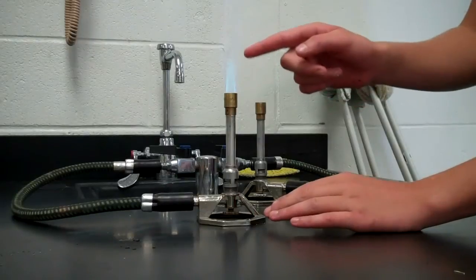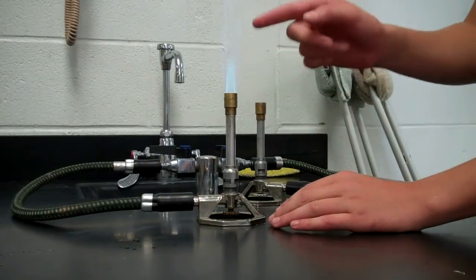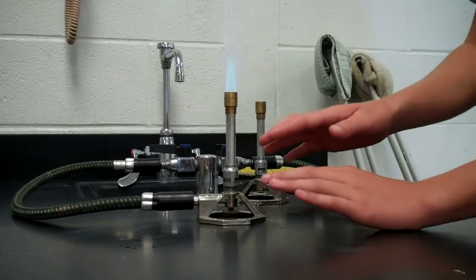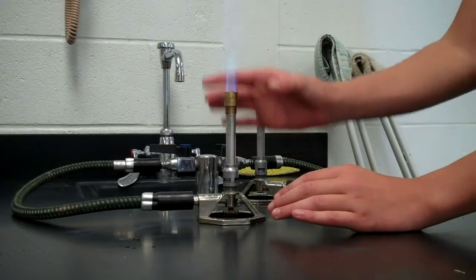This cone has no heat in it. Practically, you can put your finger in it, but don't. It's a fully lit flame.